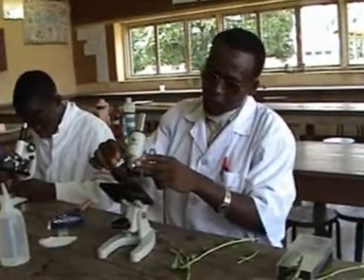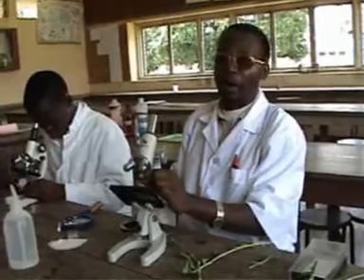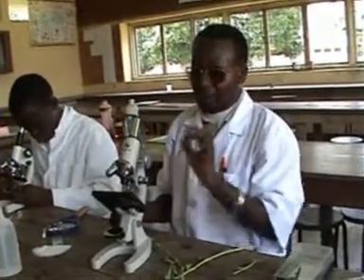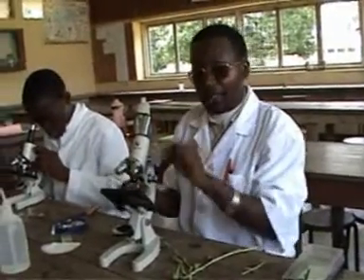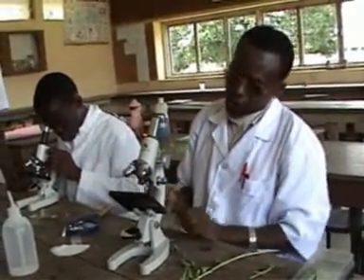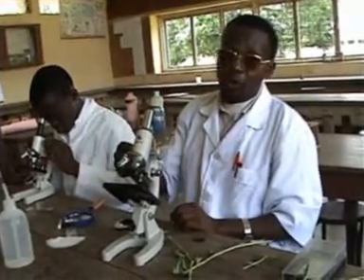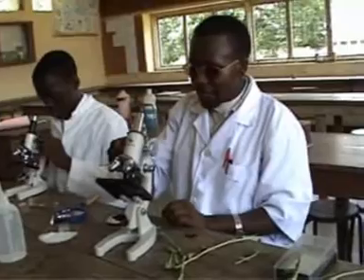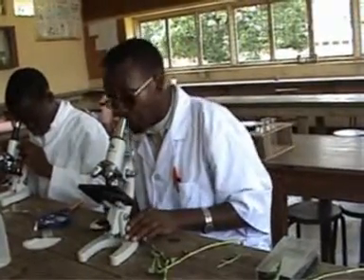And then you start your observation with the low power. So when you turn this rotating nose piece to the low power, it clicks. It makes a sound, pop. So it clicks, it means that it is already at the right point. So you click it, it goes there. Then you use the coarse adjustment, you take it down till it ends. So when it ends now, you start viewing it with your eye.